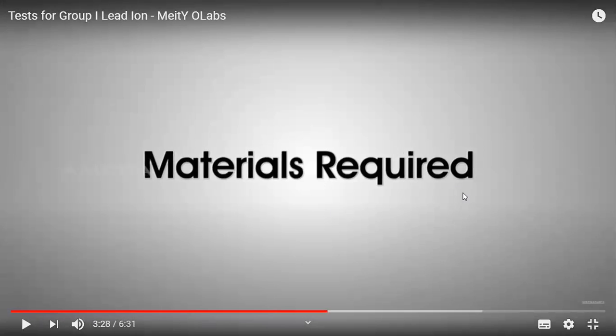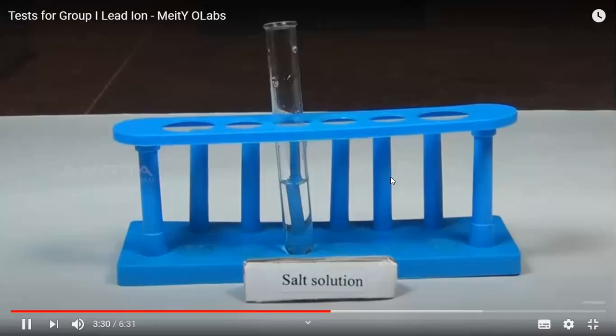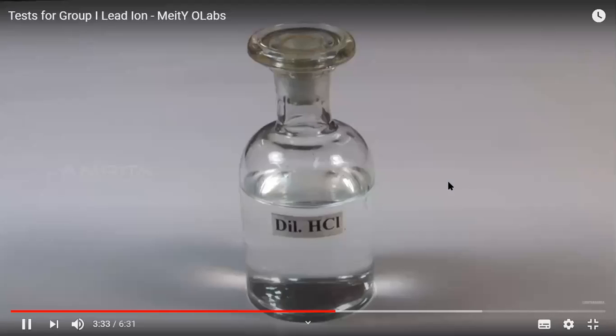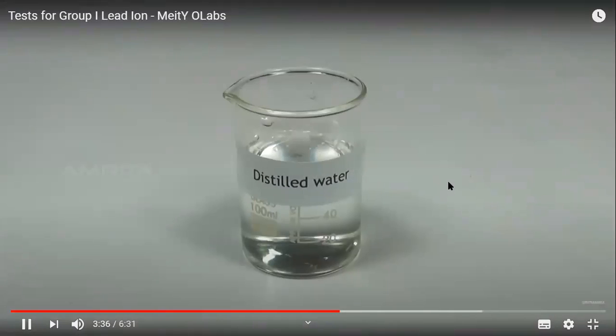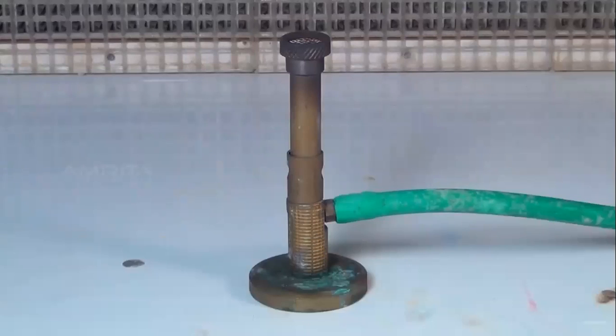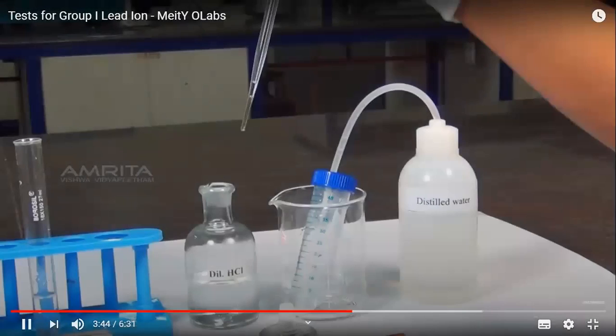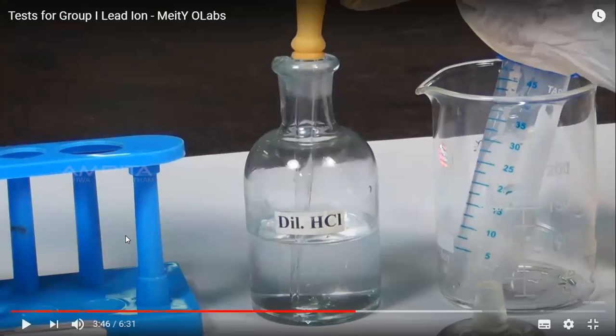The various materials required for the group analysis are salt solution, that is what we call the original solution, OS. Dilute hydrochloric acid is needed. We need distilled water and other material like test tube holder, dropper and Bunsen burner. Let us perform the test. We are going to add a small quantity of dilute hydrochloric acid to the original solution.